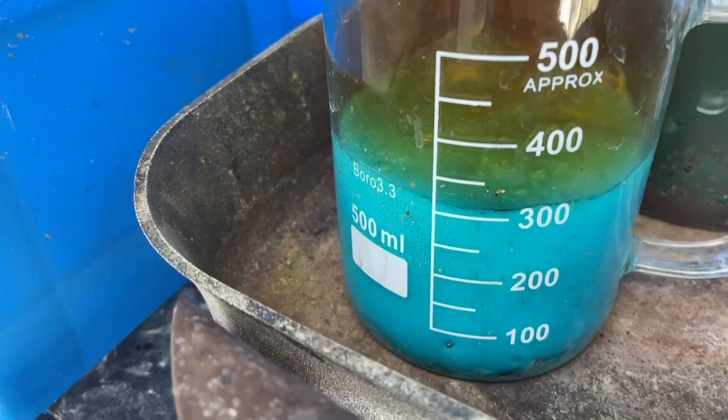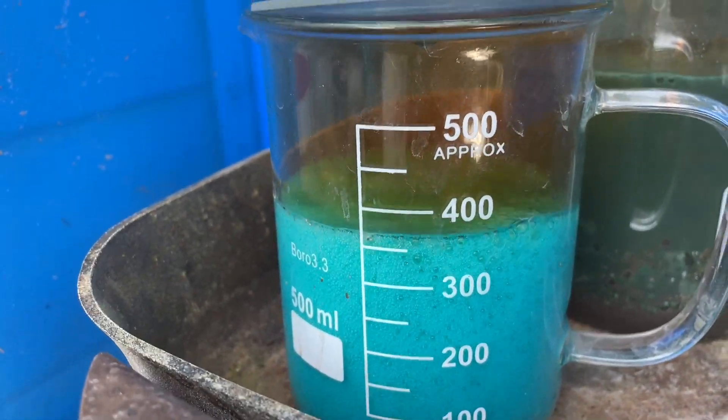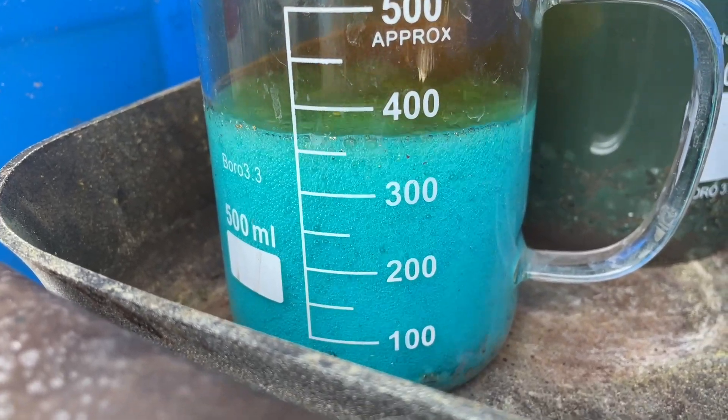I've hit that with about seven or eight more squirts just like that to get it ripping. You can see a little bit of gold floating around there now. Yeah, it's getting down to it already.